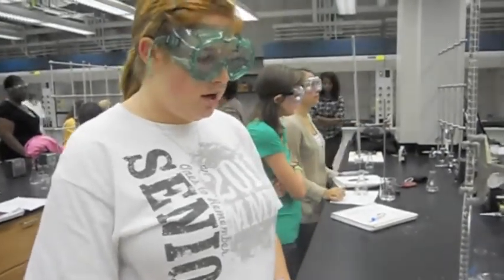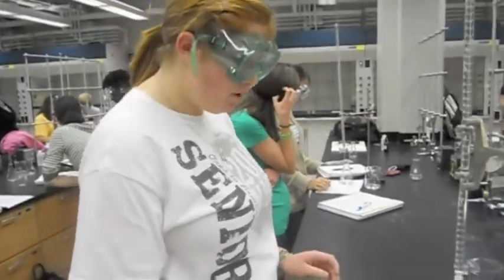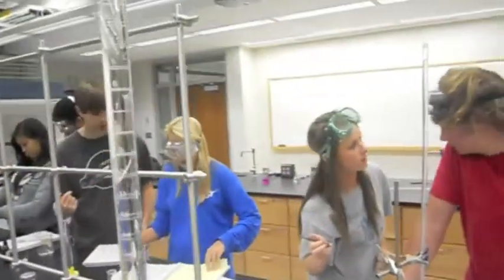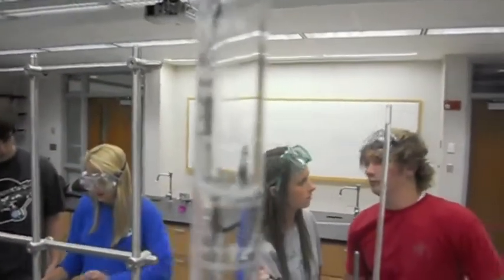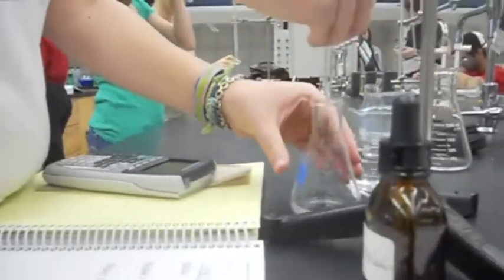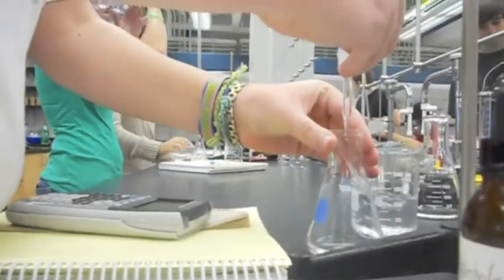This video is about using a burette to titrate NaOH into Sprite to find the concentration of citric acid. Our initial volume measurement is 0.99. And you want to slowly release this, and let some of the NaOH run into the Sprite.